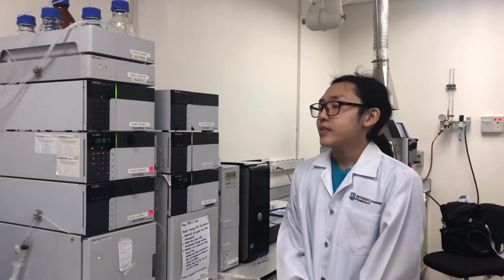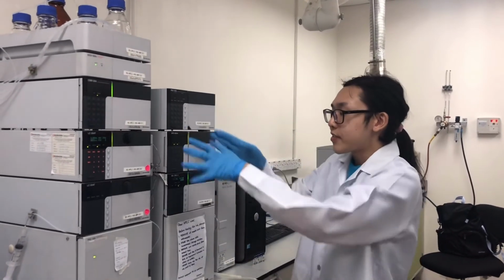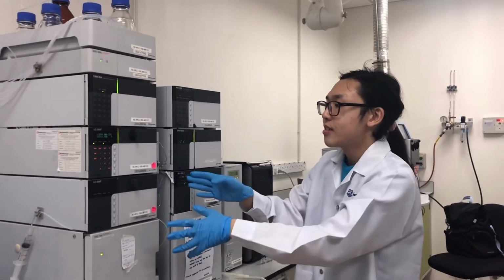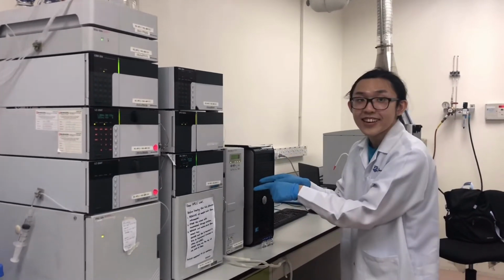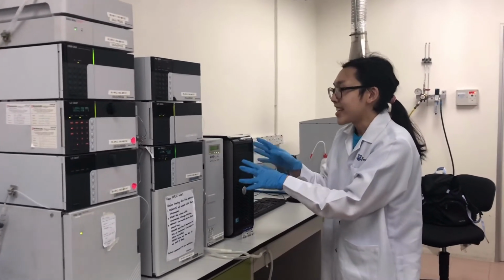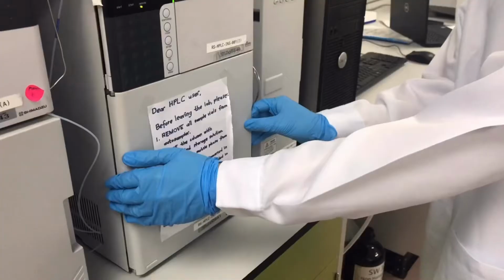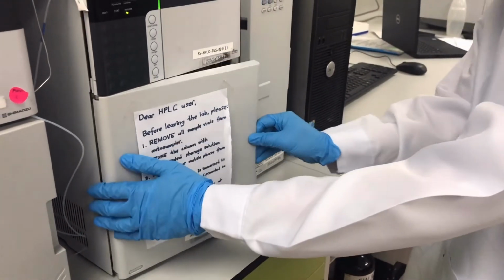Hi there, this is the HPLC machine, and these are the different components that make up the HPLC machine. As you can see, here are the pumps, and then the column goes in here and it's in an oven. I can't open it right now, but okay, so we are going to open this now to access the tray.